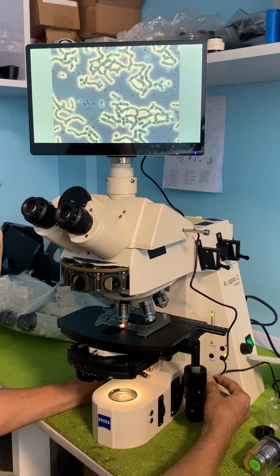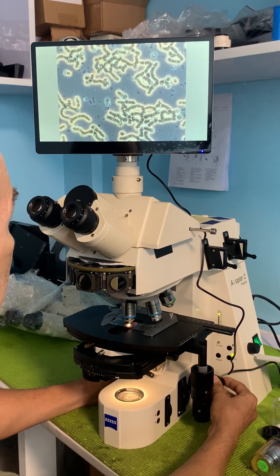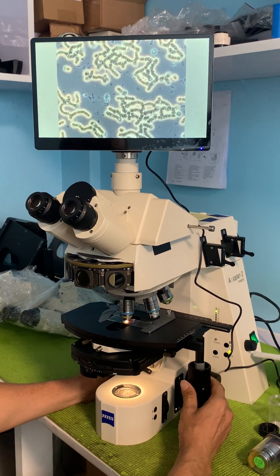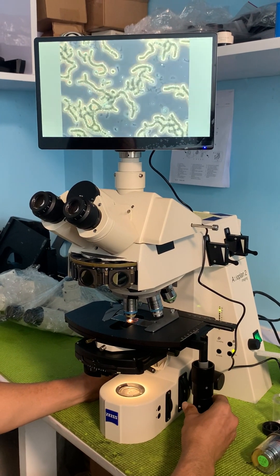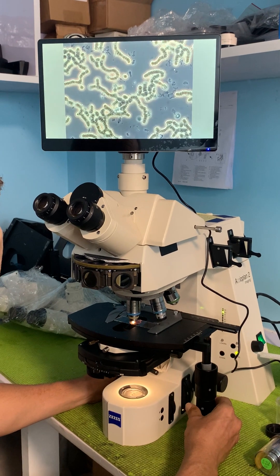So this is phase contrast. Let's move the slide around. This is a fresh live blood sample. These are all the red blood cells.